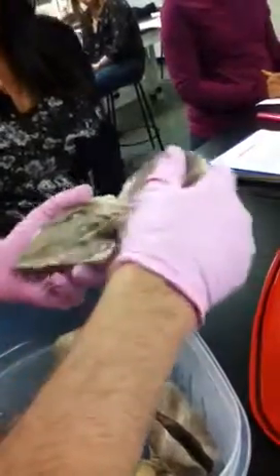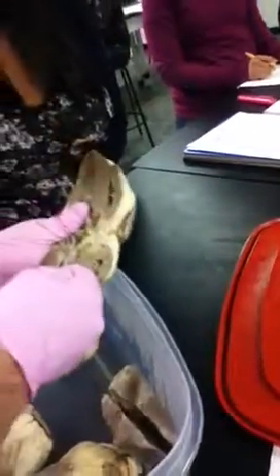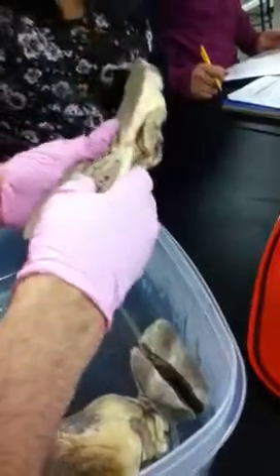There you go. So, just turning it around, if it's something tagged here that's circled like a string, it's going to be the chordae tendineae. If it's actually at the top of the string, it's going to be the AV valve.